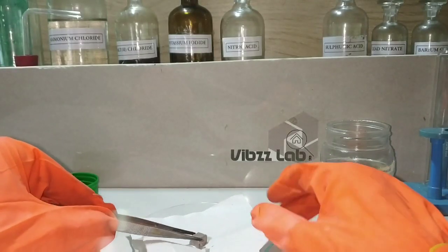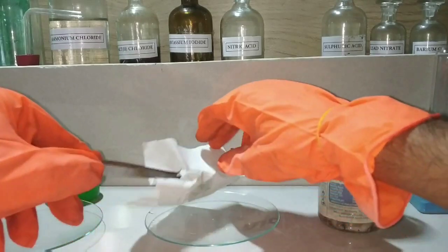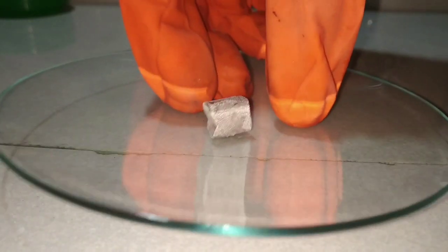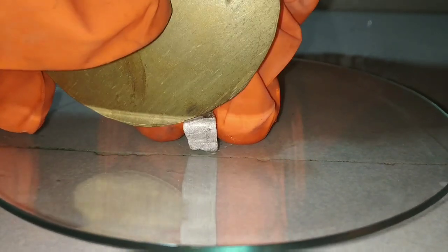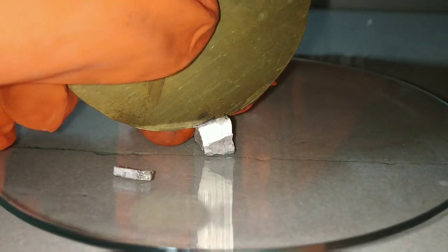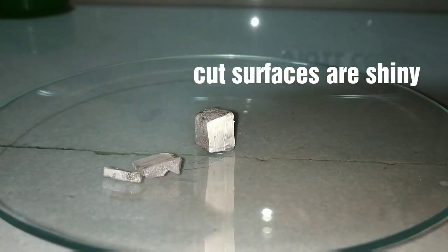Before learning about the chemical properties of sodium metal, first of all let us dry the sodium metal by using a filter paper or a paper towel to remove all the mineral oil. Sodium metal is like every other alkali metal, that is, it is very soft and you can easily cut through the metal, and the consistency is similar to a rubber piece. And on cutting you can see that the cut surfaces are very shiny, and soon those shiny surfaces will turn dull, that is because of the oxidation.